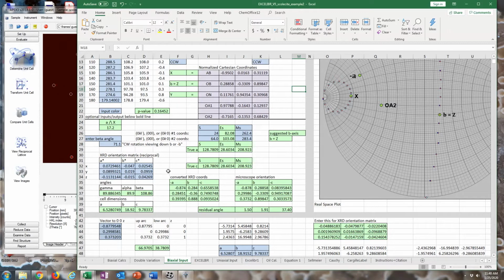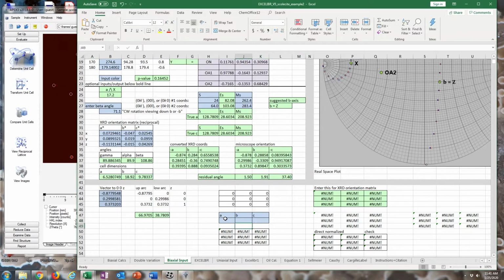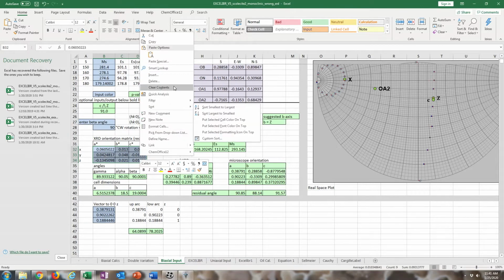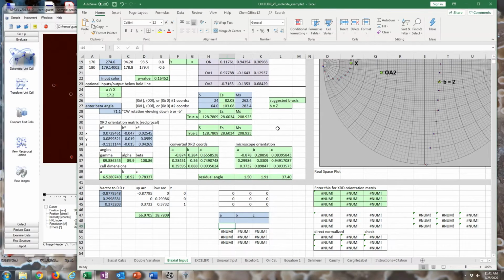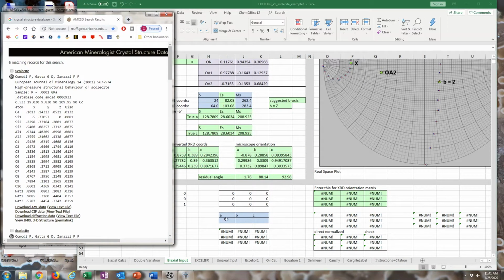And to do that, I just enter the lattice parameters to scale the matrix correctly, and hopefully you have the right microscope orientation matrix. That could be some trial and error, but in all likelihood you won't have to do all this with a normal crystal. I just picked this one because it's the hardest, the most difficult possible scenario with centering a correct lattice for a mineral.